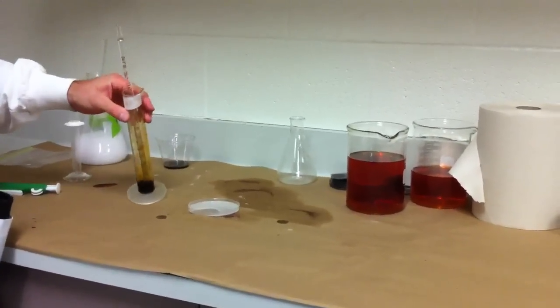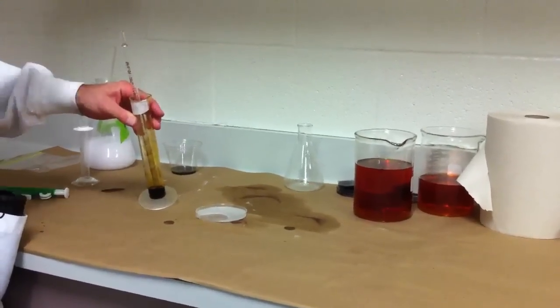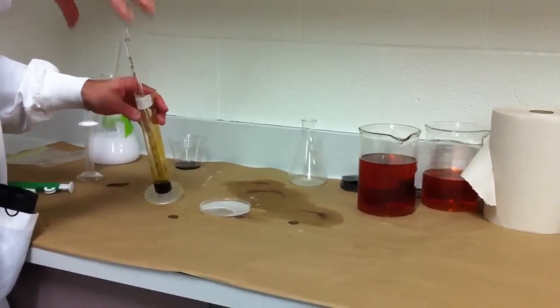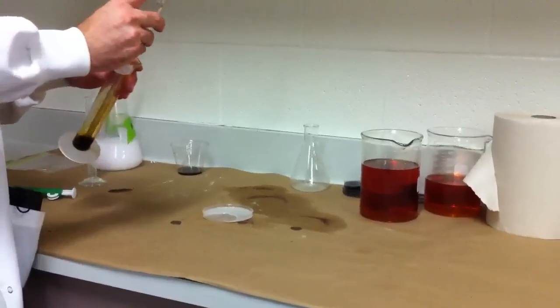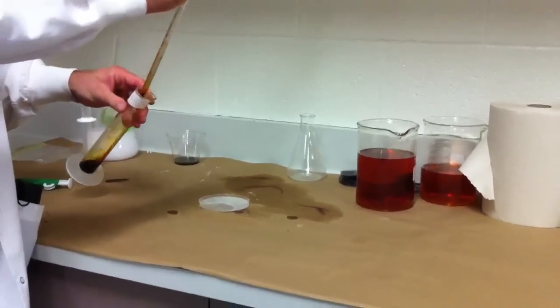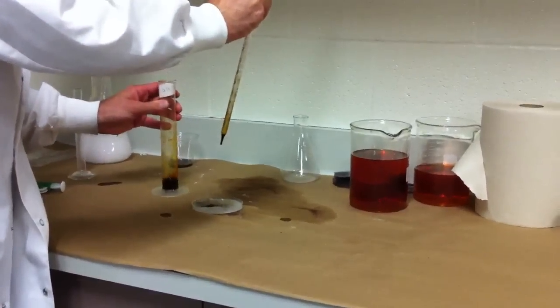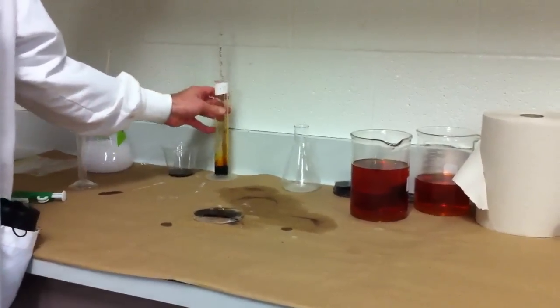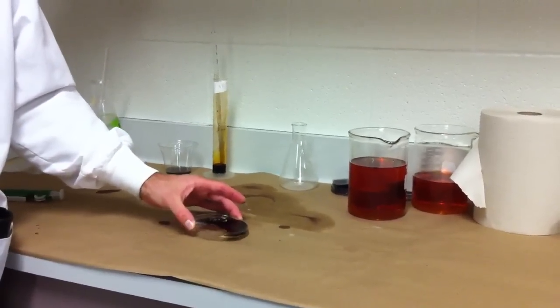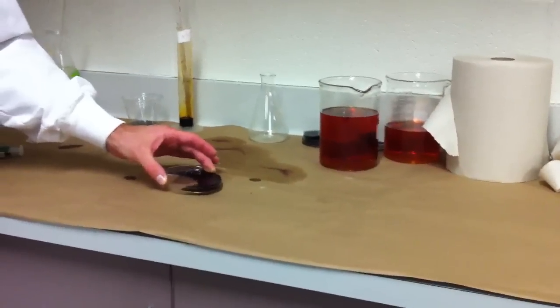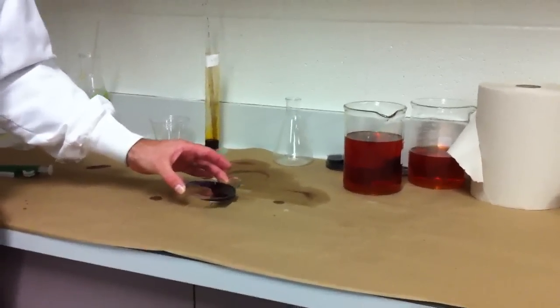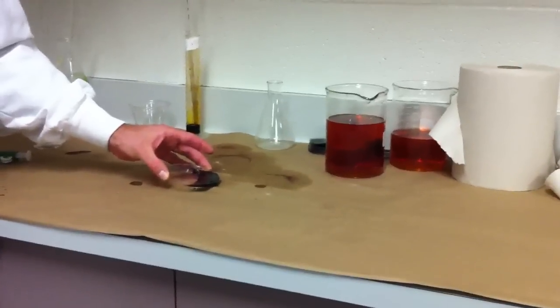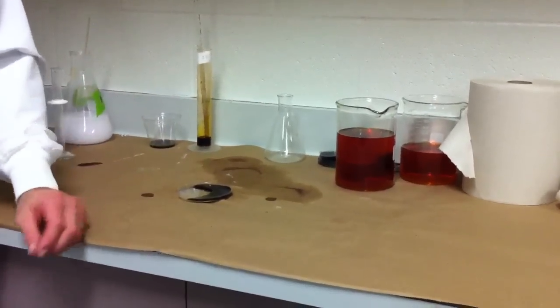This is iodine. Iodine is just a straight element. This one's dissolved in alcohol and then diluted with a little bit of water. When you have iodine and starch coming together, the white starch turns black or kind of bluish black. So it changed color. It's very rapid and very indicating a color change. That makes iodine an indicator of starch.